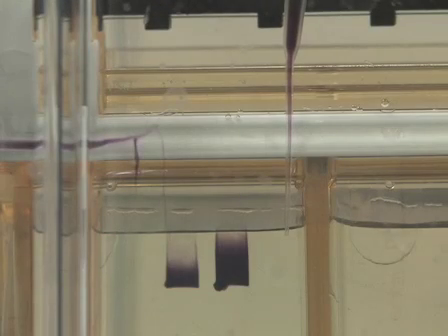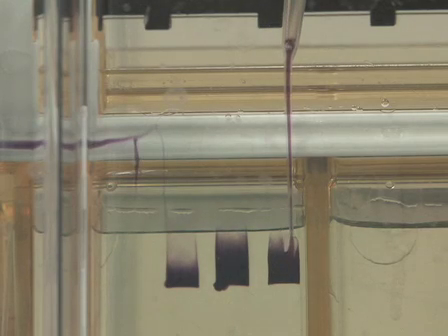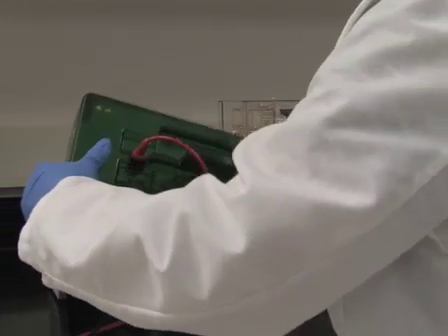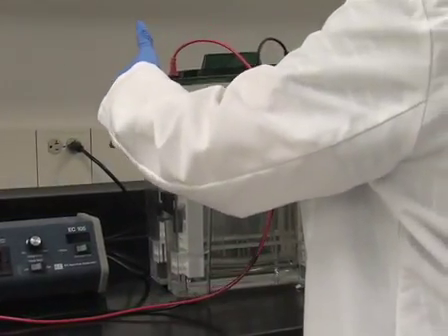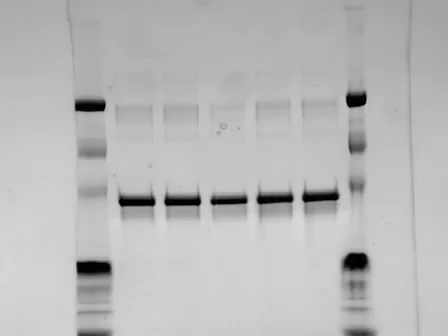In a previous video titled Electrophoretic Separation of Proteins, we demonstrated how a complex mixture of proteins could be separated using gel electrophoresis. In this video, we will show you four different gel staining methods for visualizing the location of the proteins in the gel.